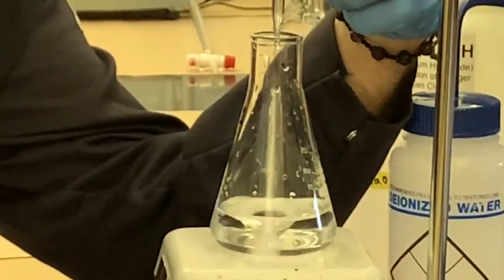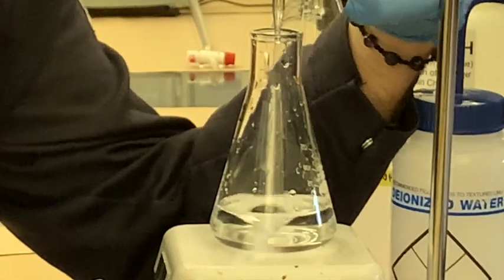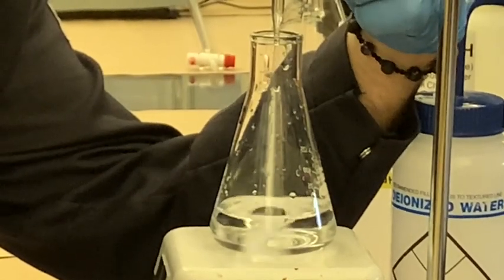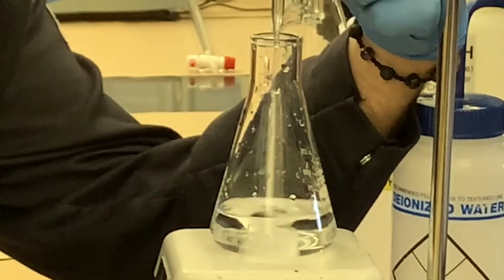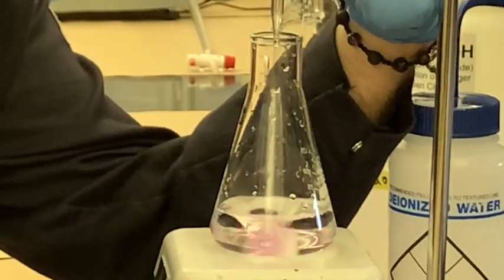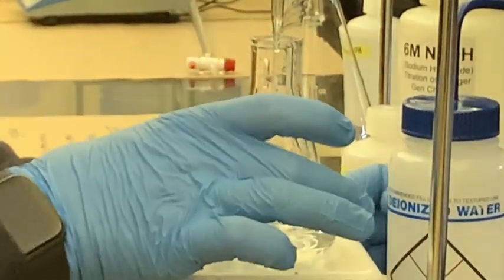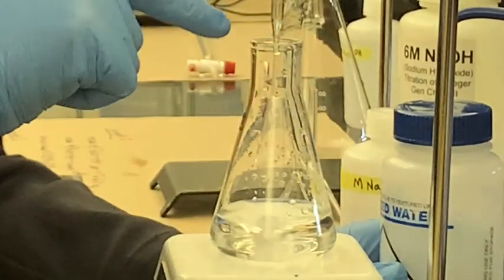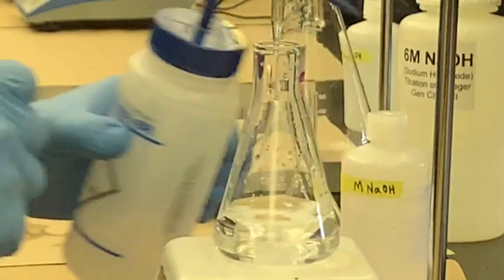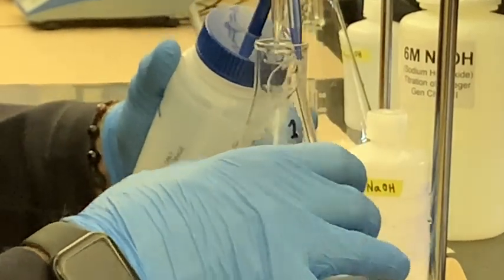A little bit more. Looks like we're getting close because we're starting to get really heavy flashes of the pink, a sign that the actual titration is over, also known as the endpoint. Thankfully, we have a stir bar, which is helping us homogenize the solution quickly. One technique that is really good if you get close is, instead of actually adding a full drop, you can touch the side of the flask and wash down that drop if you're trying to be extra careful. Looks like it was not enough anyways.